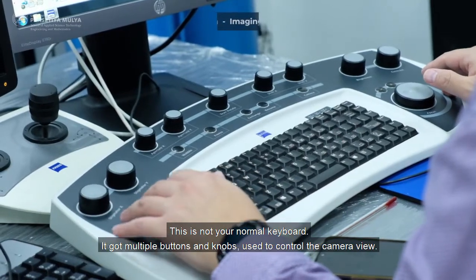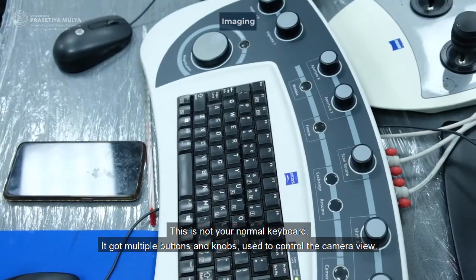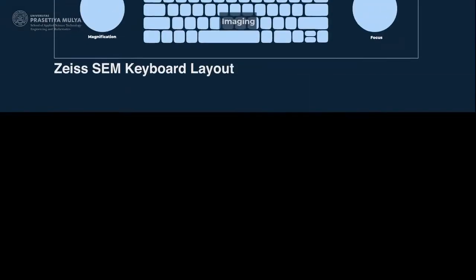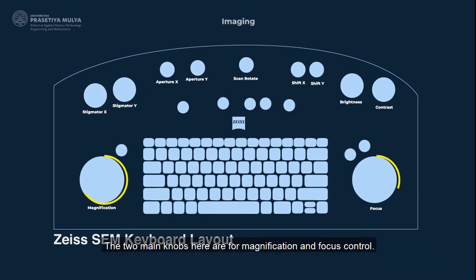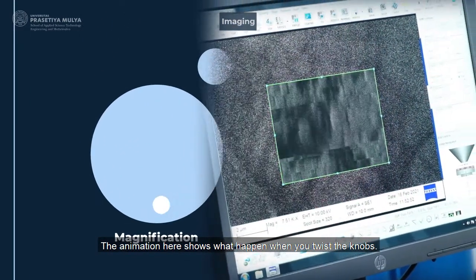This is not your normal keyboard. It got multiple buttons and knobs used to control the camera view. The two main knobs here are for magnification and focus control. The animation here shows what happens when you twist the knobs.